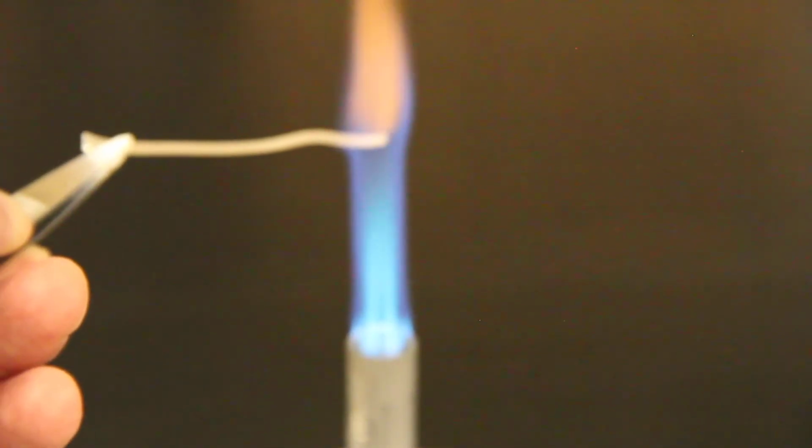So we will just heat this magnesium metal up, and you can see that it burns super duper brightly. Well, you could see it. There you go. I wouldn't look directly at it, and hopefully it doesn't damage my camera. It is really, really bright. I didn't look at it with my eyes directly because it can end up leaving an impression that won't go away even when you close your eyes if you look at it too much.